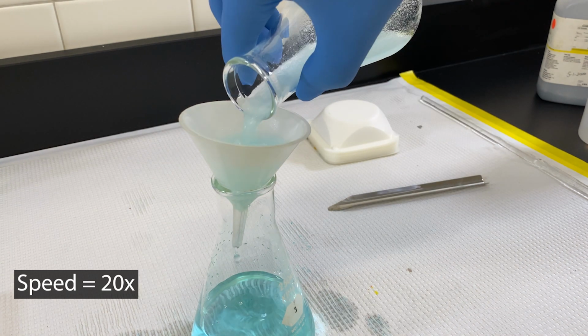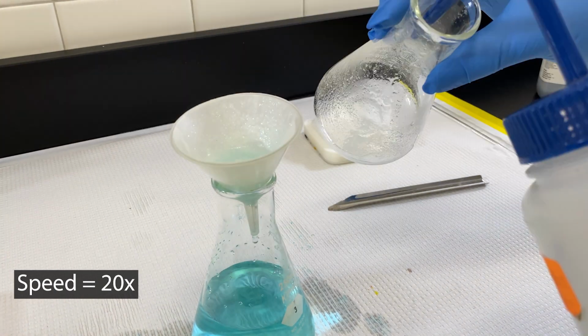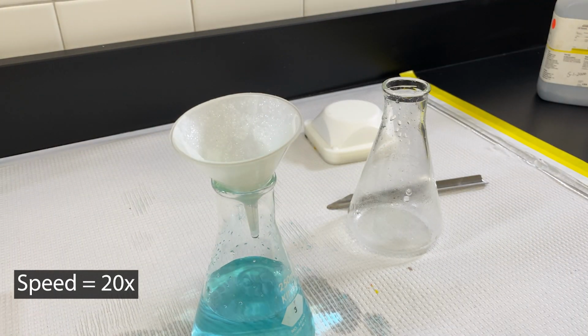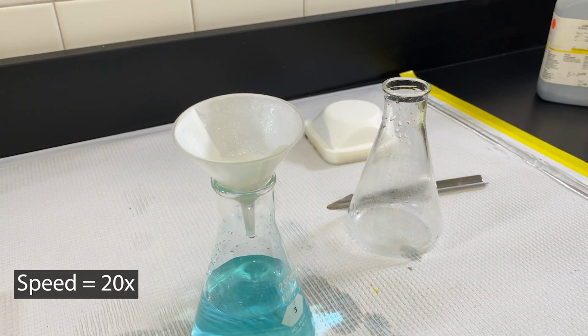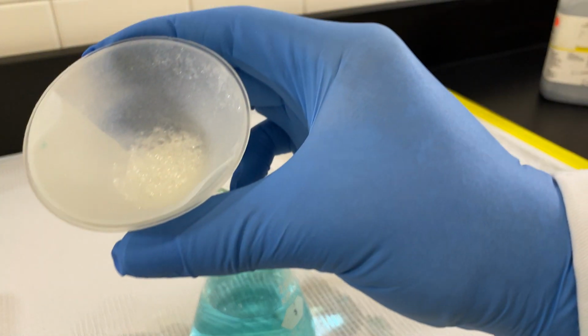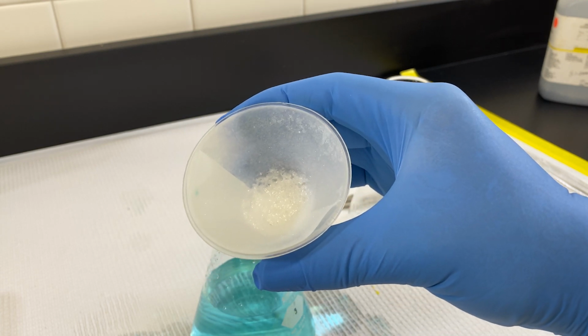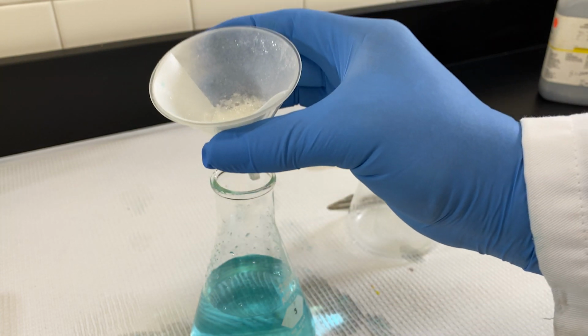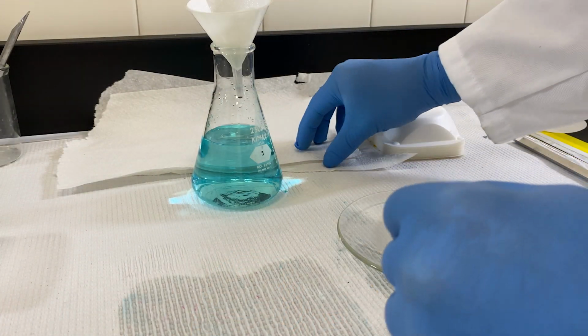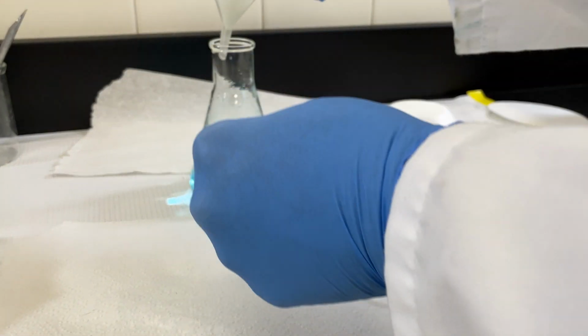The filtration is concluded when all of the material is in, the Erlenmeyer flask has been rinsed, and one final rinse of the recovered material. The white precipitate has now been filtered from the solution. And so our original mixture has now been separated into three relatively pure components.